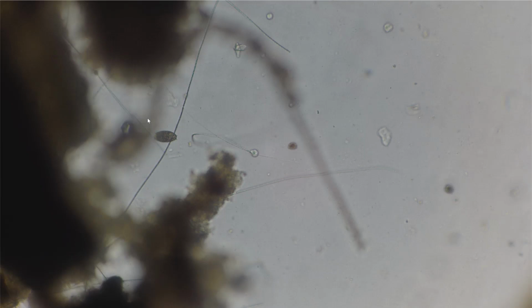So here I'm still inside of the selection tool. So I can just left click once, and then I can drag my mouse until I have covered the area in which my organism is located. The closer the better, right? Because otherwise we are just sampling empty pixels.